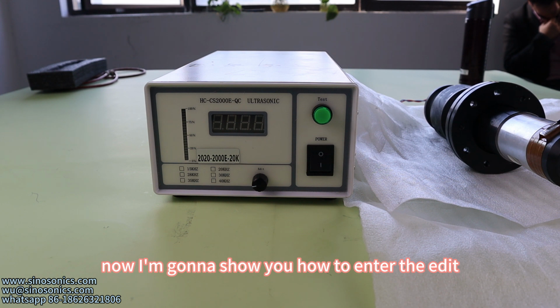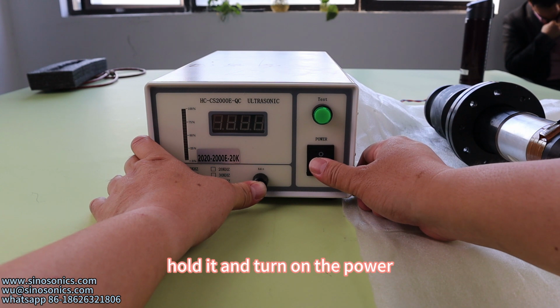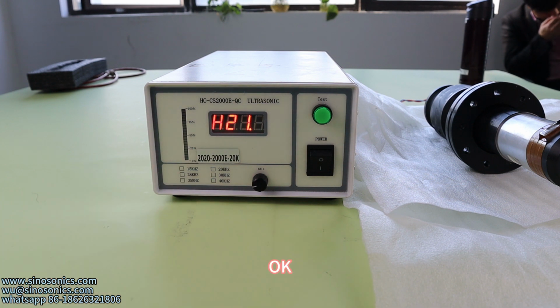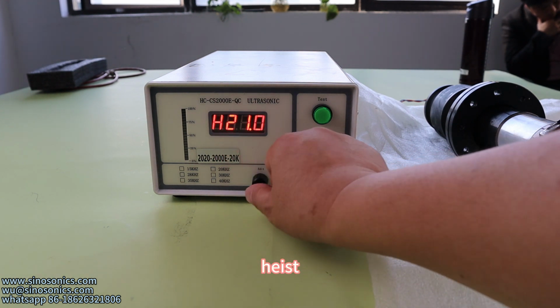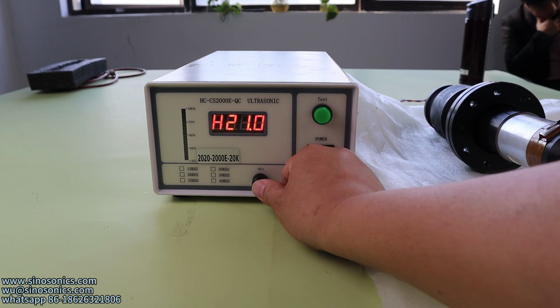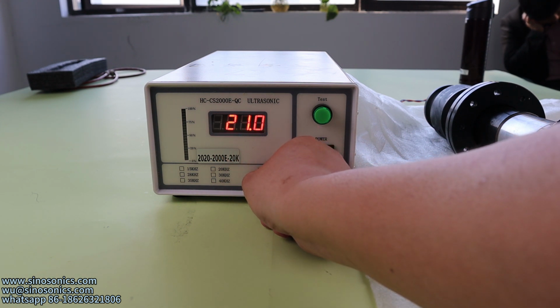Now I'm gonna show you how to enter the edit menu. Press the edit button, hold it, and turn on the power. Enter the edit menu. Highest, short press the edit button. See the H. H means the highest frequency.